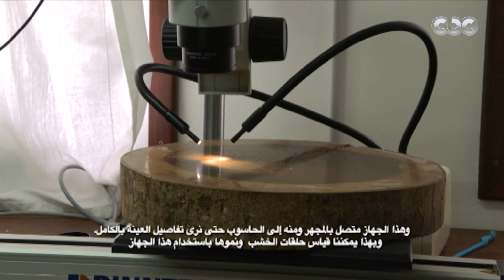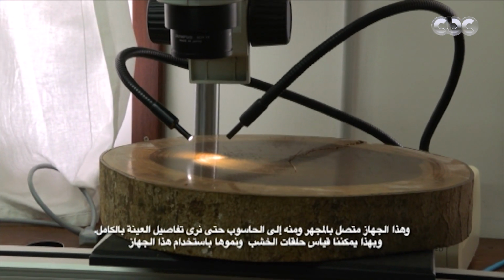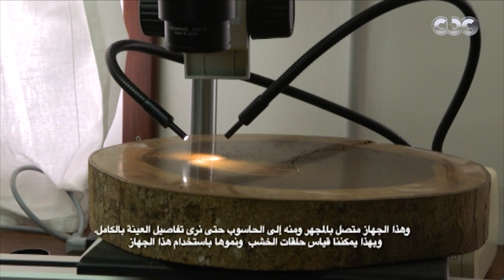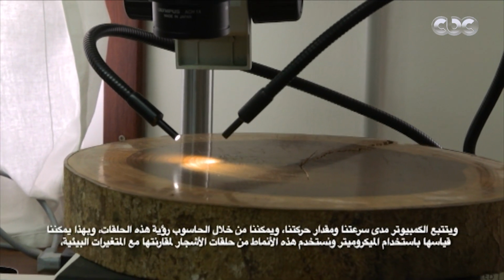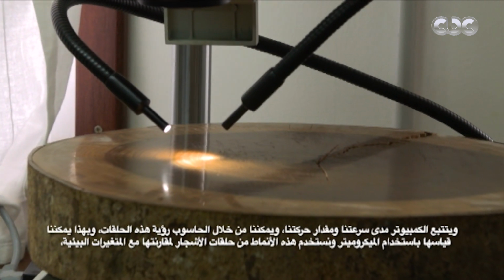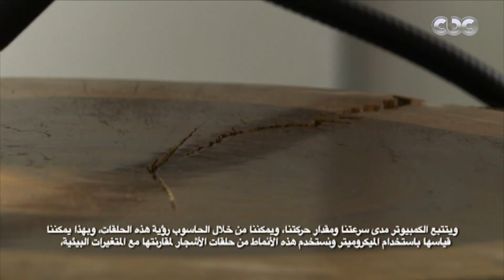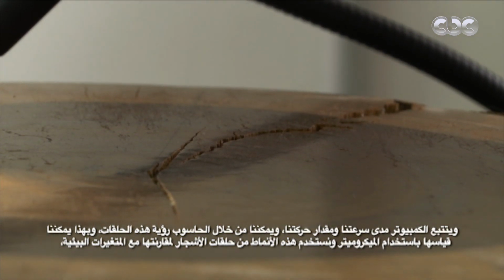And under the microscope, what we're doing here is we indicate the boundaries of each tree ring. With this device here that is coupled to the microscope and to the computer, we can actually directly see what we see under the microscope. We can also directly see it on the computer. So it's all connected to a computer, and we can actually measure the growth rings by using this device. So here with this device, the computer tracks how fast and how much we move.